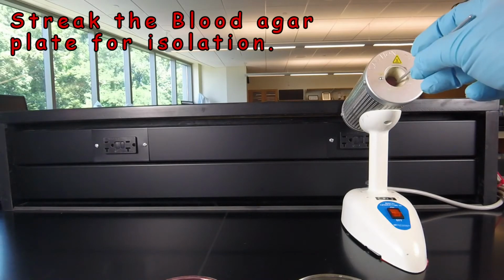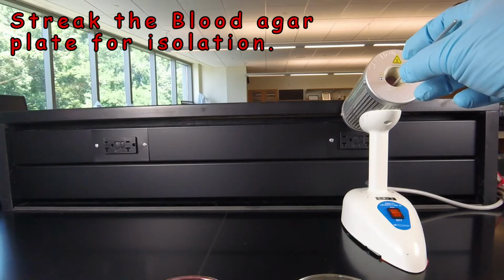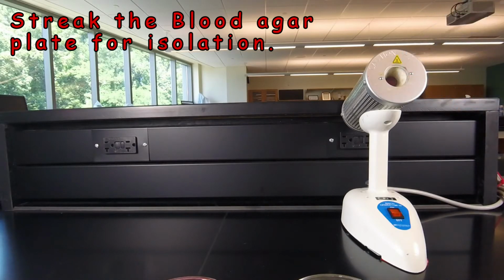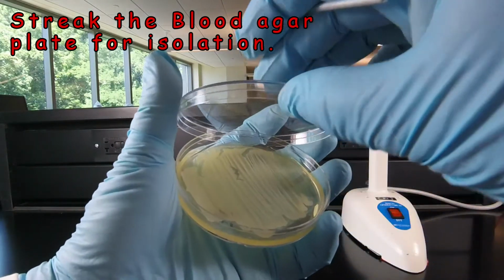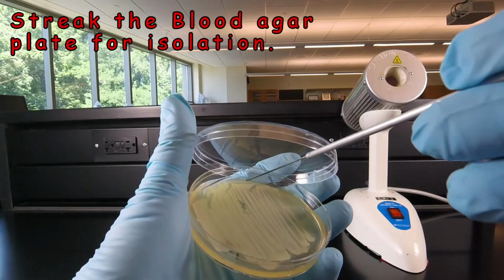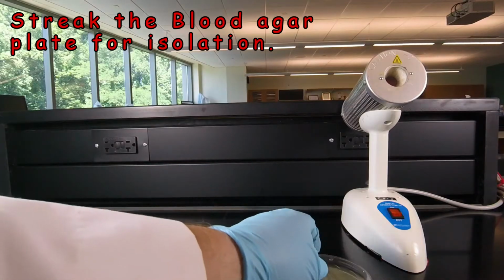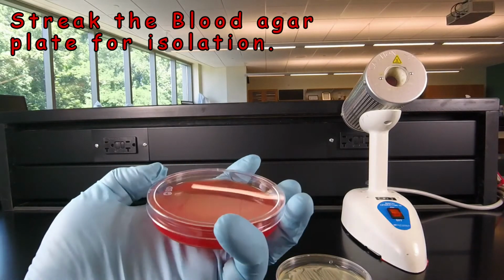So we sterilize our inoculating loop as normal. And then we're going to remove some of our unknown bacterium. So we stick the loop in the agar to cool at the edge and scrape off a little bit of bacteria. And we're ready to inoculate the blood agar plate.